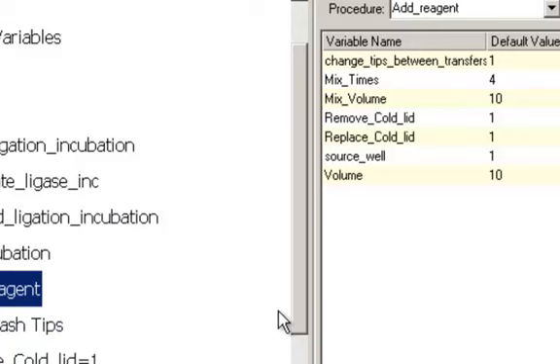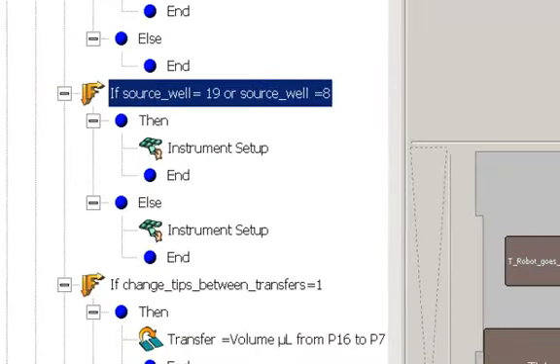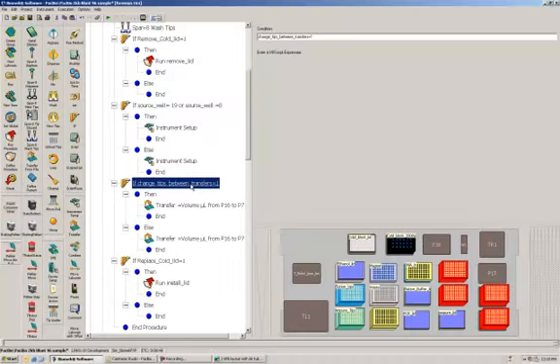Now let's look a little deeper into the procedure. Okay, if you remember, in our cold block, we had two 2 mil tubes. This if step here, those 2 mil tubes were at location 19 and 8 in that cold block. And what this if step does is it swaps the cold block from a 500 microliter cold block to a 2 mil cold block. As this procedure runs, it looks at what is your source tube, and if you're coming from either tube 19 or tube 8, it changes the instrument setup so it knows it's a 2 mil tube. If it's not those tubes, it's going to set the cold block to a 500 microliter tube.